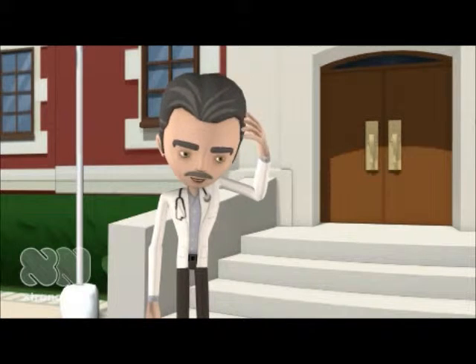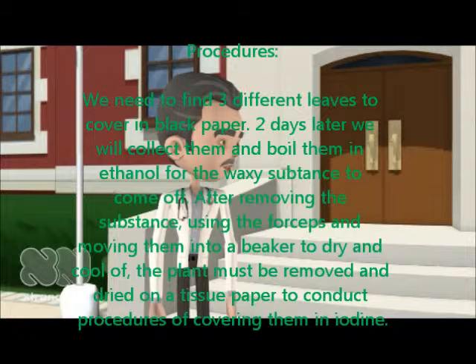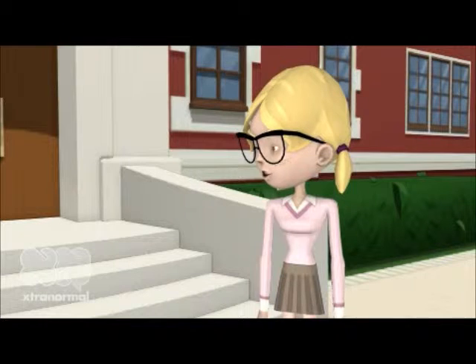You are a very smart little girl, aren't you? Now, we need to find 3 leaves that are not too waxy, to cover them in black paper. 1 leaf fully, 1 leaf only half, and 1 leaf not at all. After you've done that, we need to leave it to settle for a while and then conduct procedures of boiling in ethanol and covering in iodine to experiment on which leaves have a lot of starch remaining and which don't. Wow, that's a lot of procedures.